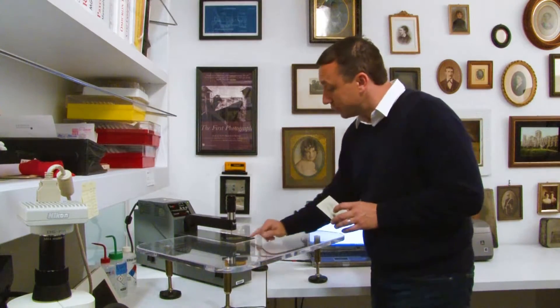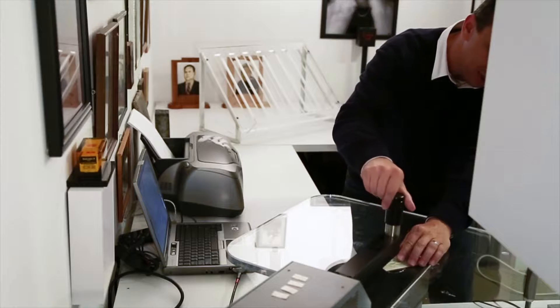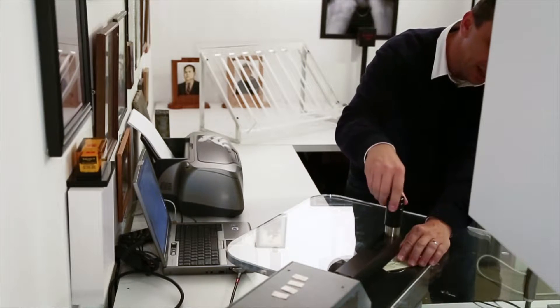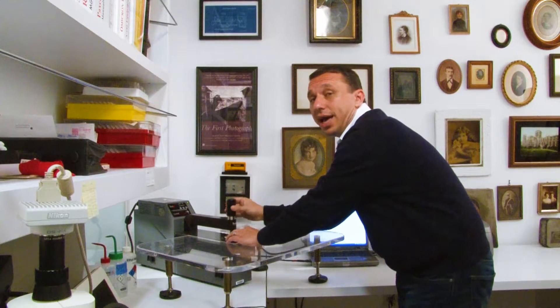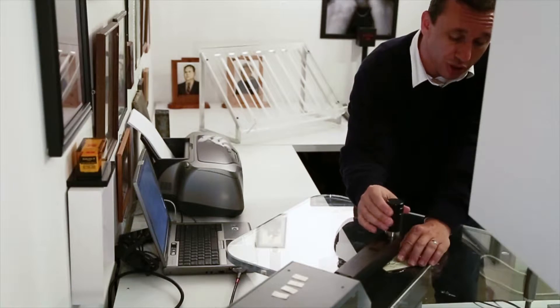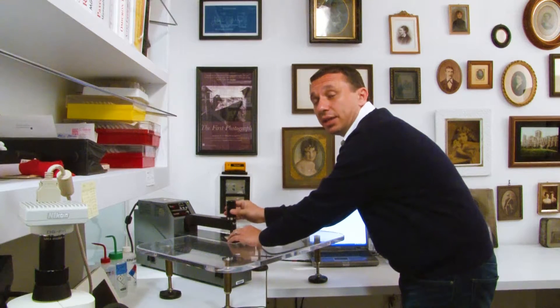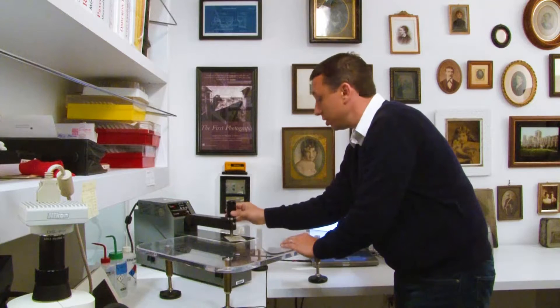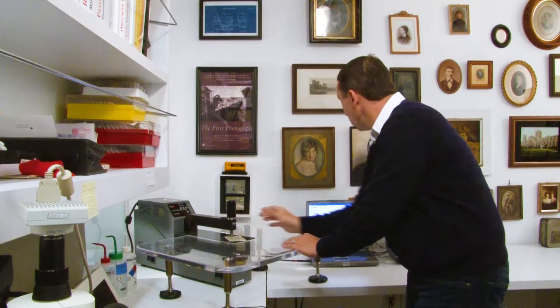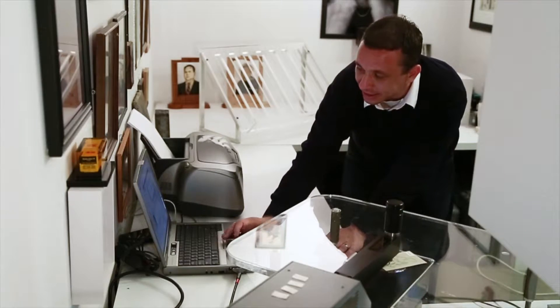What I'm going to do is place the image face down on a little diamond window that's on top of the instrument. In this technique we do need contact between the object and the diamond window, but it's really light contact — up to just seven pounds per square inch — and once we have that we'll start our analysis.